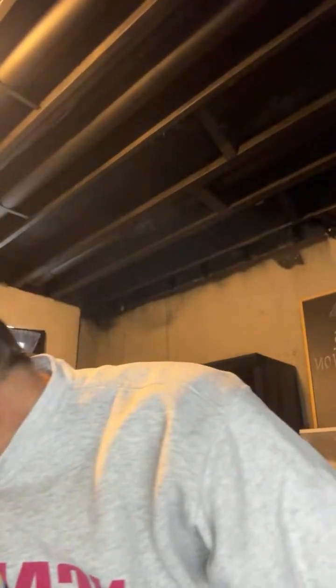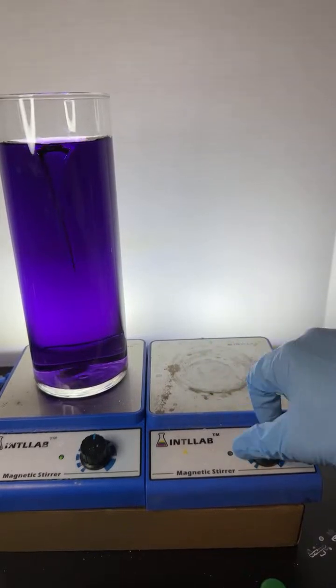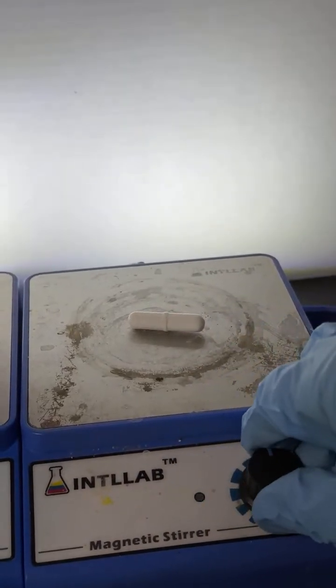Oh, nice, administrator. What happens if I put the spinner on it without a beaker? Let's just do it. Put the spinner on without a beaker. Oh, okay. Hold on. Here's a big spinner. We'll stick it on there. We'll flip the camera back around. I look like this. That's hilarious. In my younger years, I was an athlete. All right, there we go. There's a stir bar. Turn that baby on.